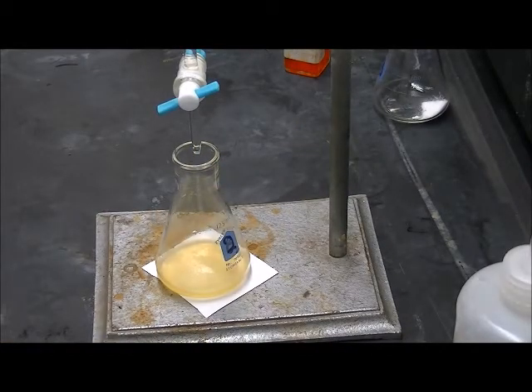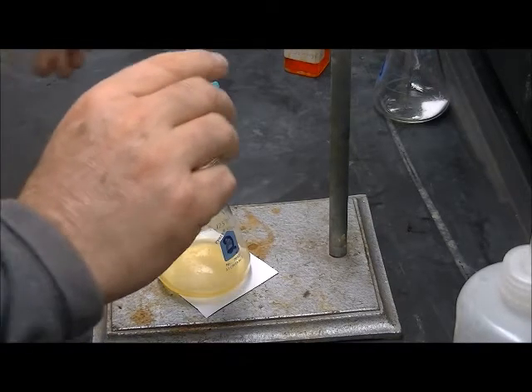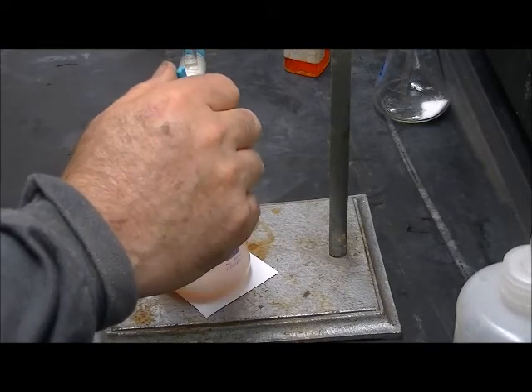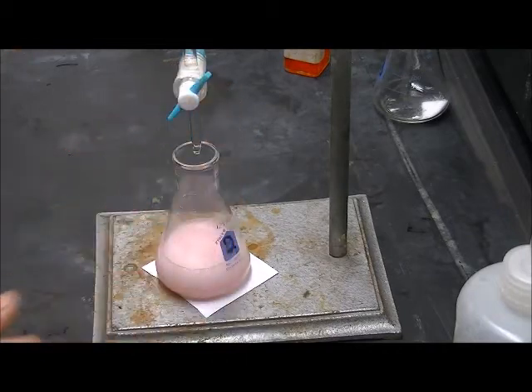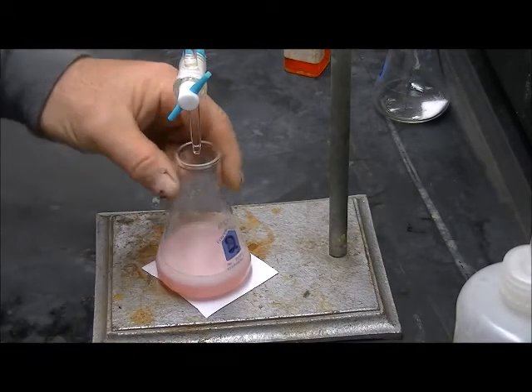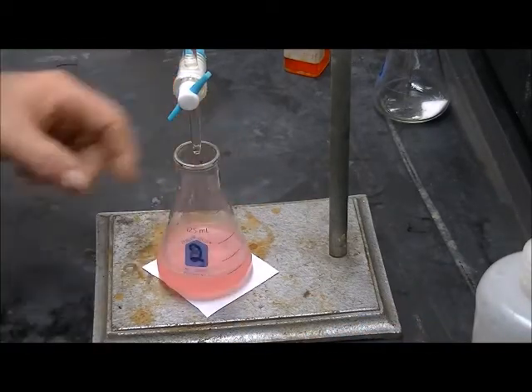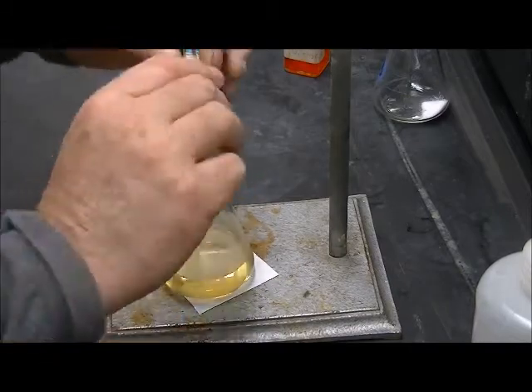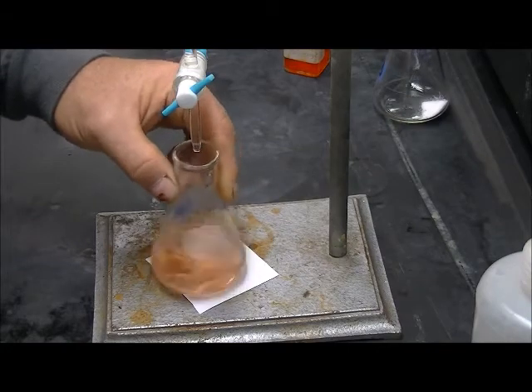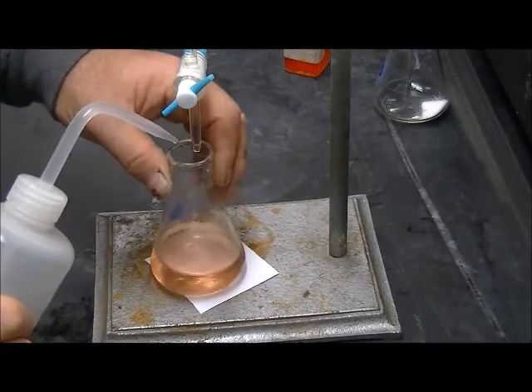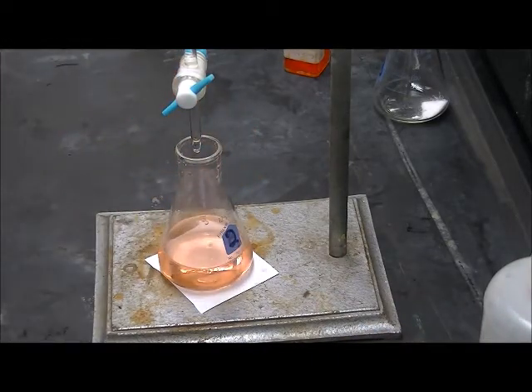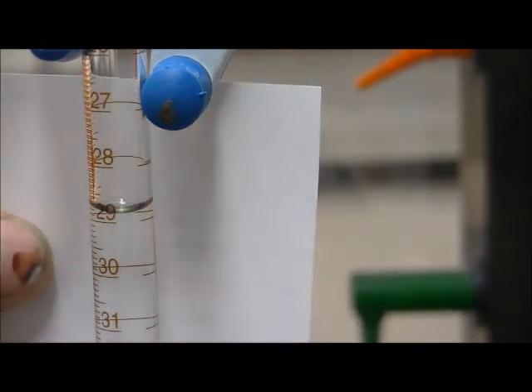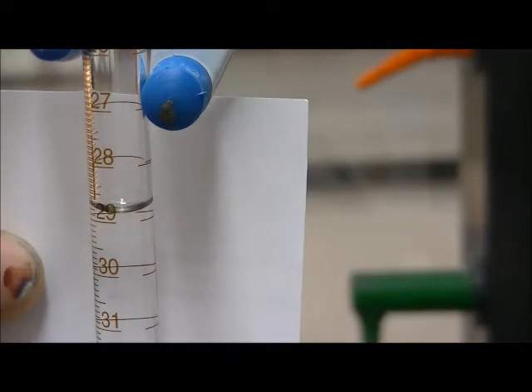OK, this is the second sample. I've already refilled my burette. I've added my indicator and some water to help dissolve it. So now I'm just going to run a bunch of titrant in there all at once. This is a slightly larger sample than our first one. So I can go pretty rapidly down until about a milliliter from the end. And it looks like that is our end point right there. So our end point is at 28.9 milliliters.